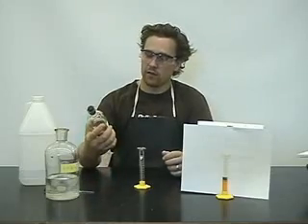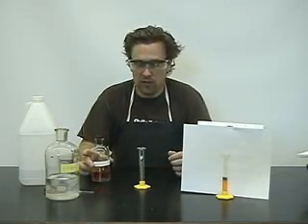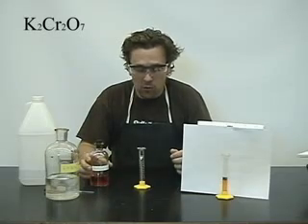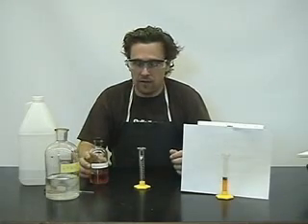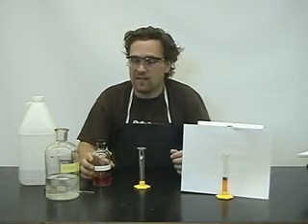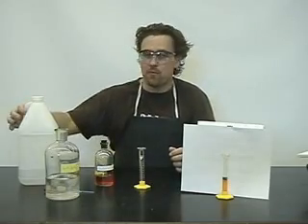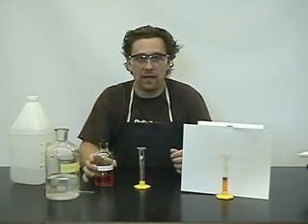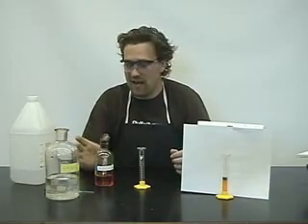Now what we've prepared is a solution of potassium dichromate. Now we'll remember that dichromate is an excellent oxidizing agent. We have some ethyl alcohol. The dichromate oxidizes the alcohol.